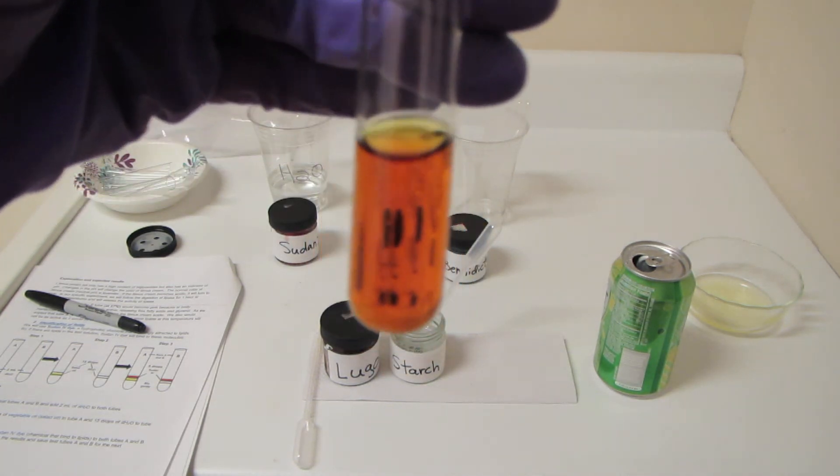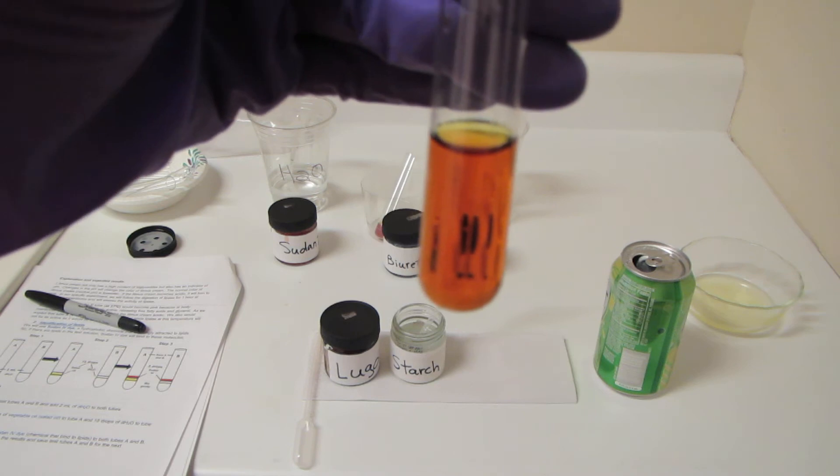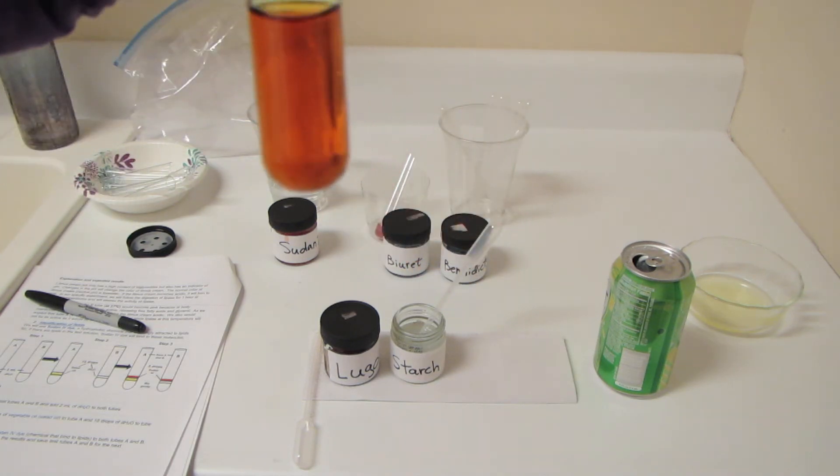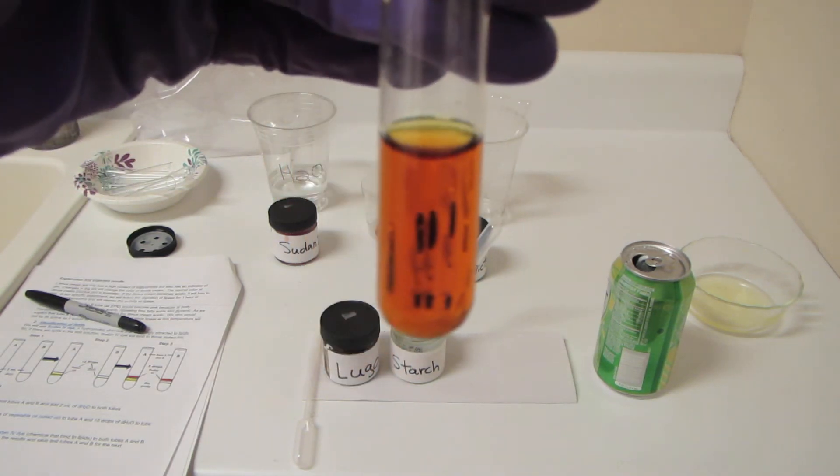If you take a look at what happened, we have pretty much nothing going on. Maybe we diluted the color a little bit, but it's still amber-brown.